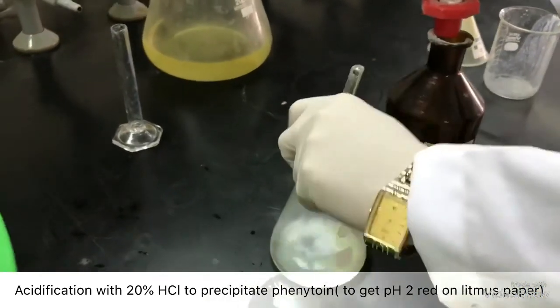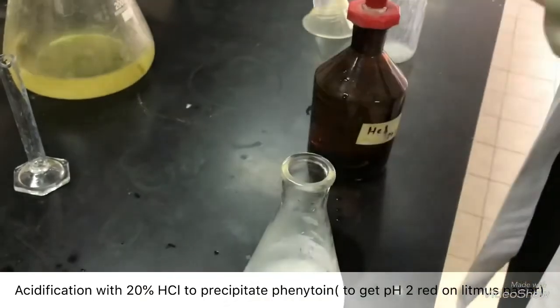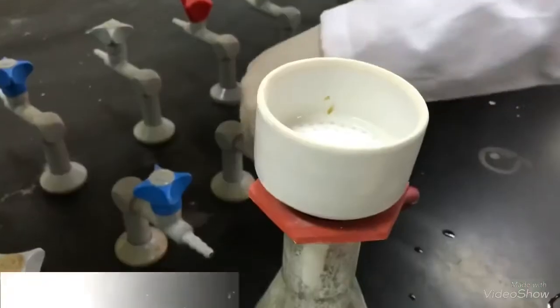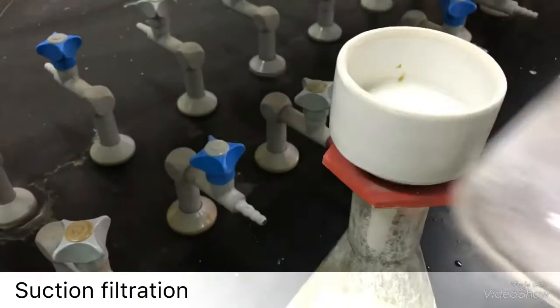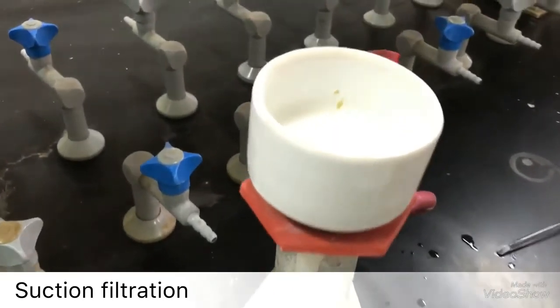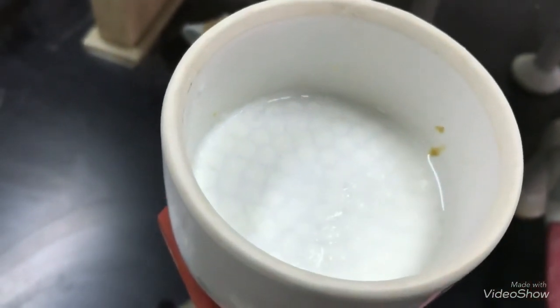Now, add 10 ml of water. Collect your product using suction filtration after cooling it in the ice bath. Now, rinse it with some water. Your product is finally ready.